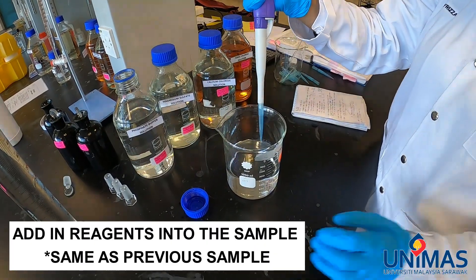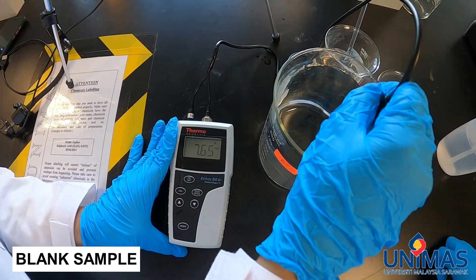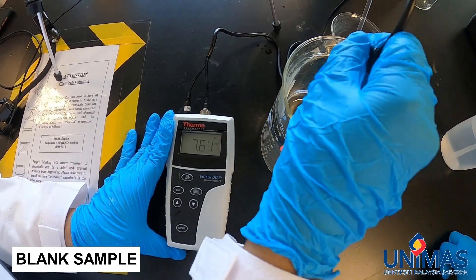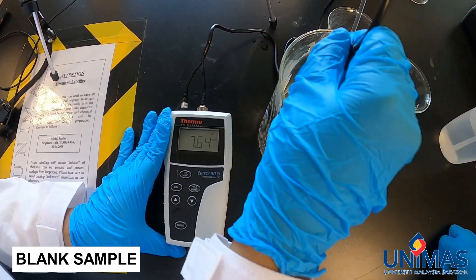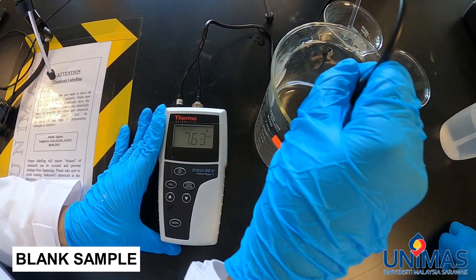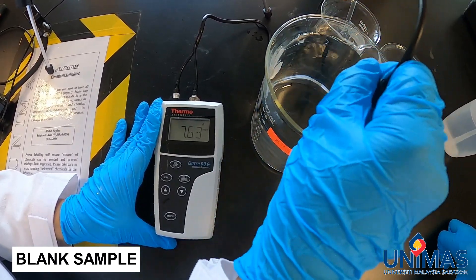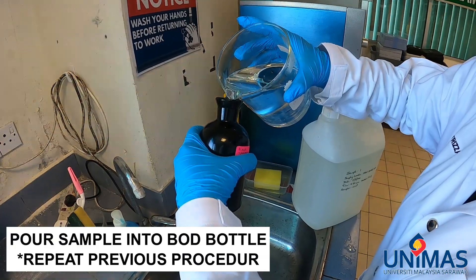Now we are preparing a blank sample, which is only distilled water. We are taking the dissolved oxygen reading for the blank sample. It is fluctuating around 7.64, then dropping to 7.62 — stabilizing around 7.63. This is the filling for the blank sample.